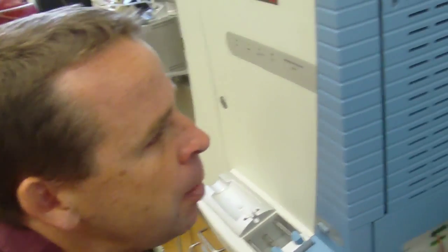Now, online here, there's a site called Matrix Science. Okay.